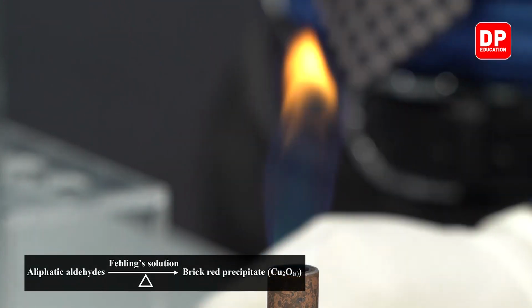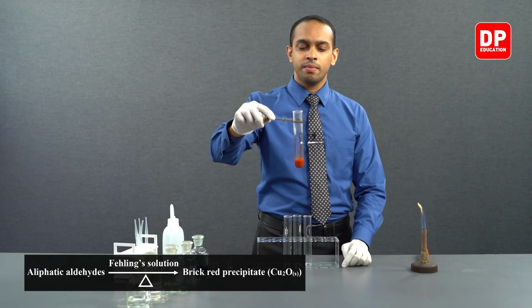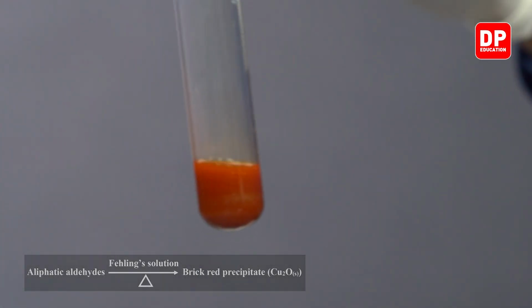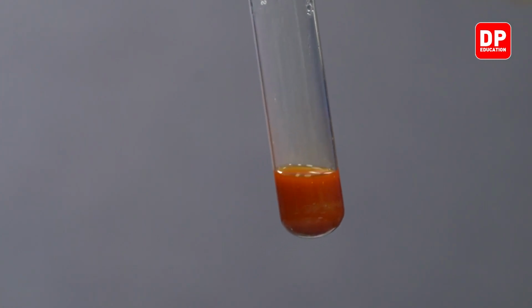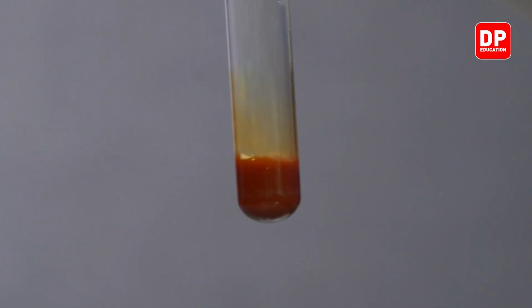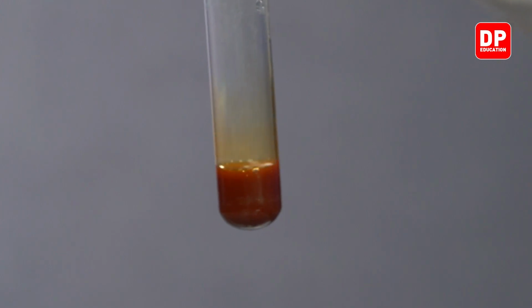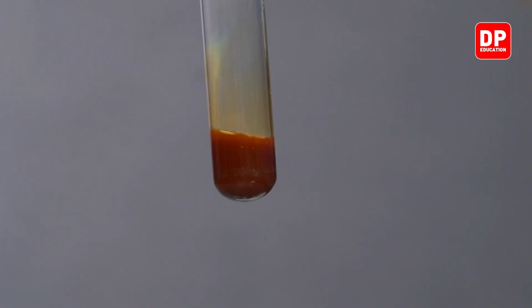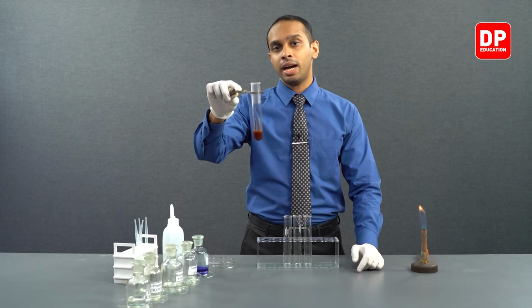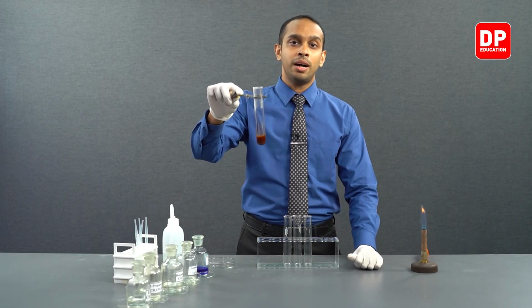Students, you can observe here the formation of a brick red precipitate. Although it appears as if it is a solution, what you see here is the formation of a brick red color precipitate. In the initial Fehling's solution, we had copper 2+ ions, and when it reacts with the aldehyde, the aldehyde oxidizes to a carboxylic acid.